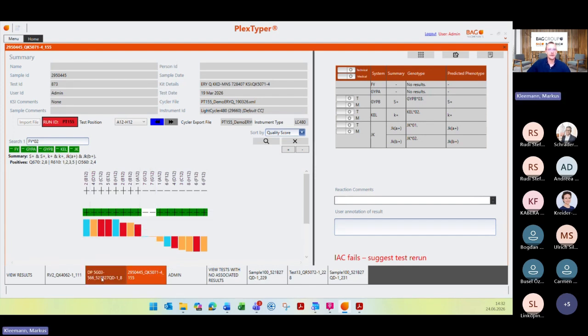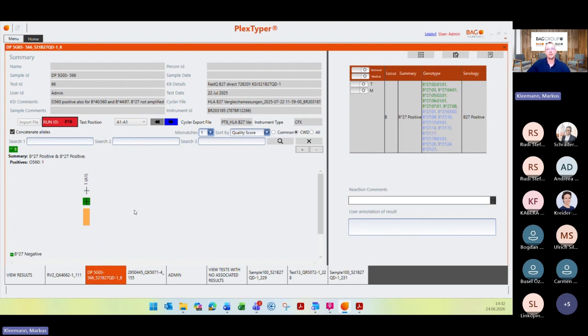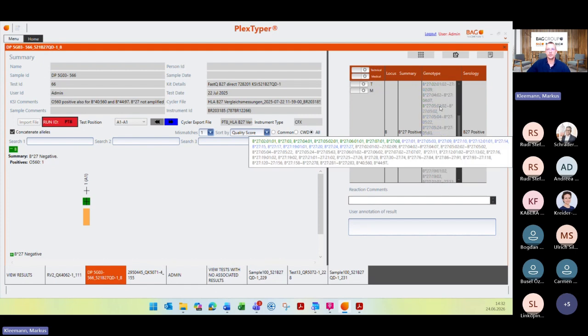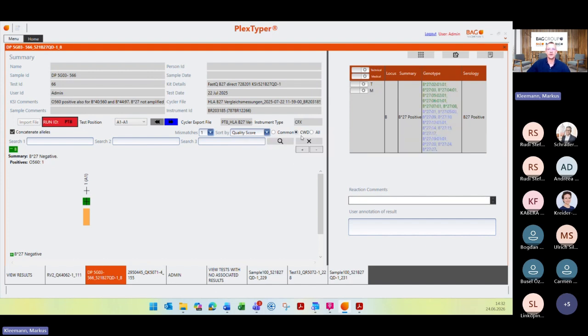And then another one for B27, because we already talked about FastQ B27 Direct. You have the option here for this area to look at only the common and well-documented alleles, which are the well-documented ones in blue, and also all alleles, which are also these rare ones here in gray. So it's up to you what you want to report. I think most of the customers do the common and well-documented ones, especially also for Rainbow.